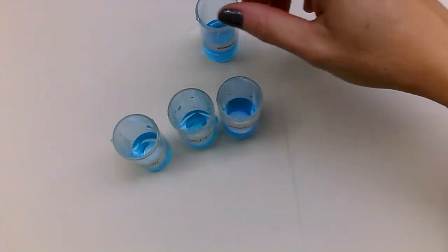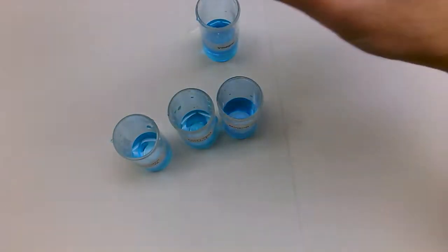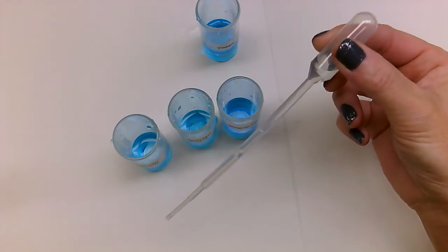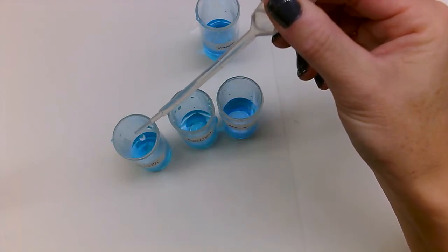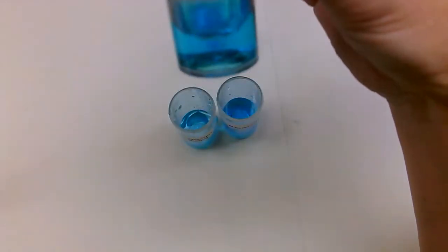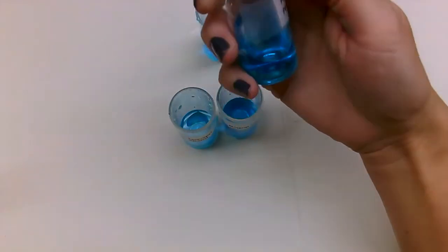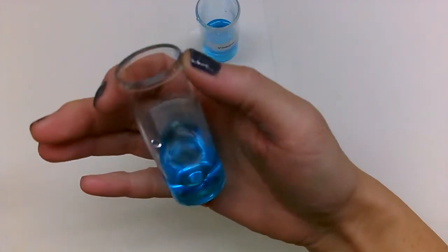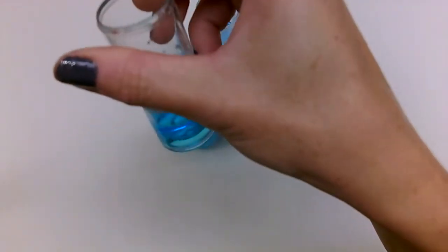So we're going to take our hydrogen peroxide, isopropyl alcohol. Okay, so right here I have hydrogen peroxide. I'm going to take my pipette full of it, and I'm going to put 10 drops or so into it, swirl it, and I'm going to look carefully and see, does it mix? Okay, is it soluble? If it is soluble, it mixes together and it doesn't look like there's anything different going on. Okay, and this one looks like it did mix together.